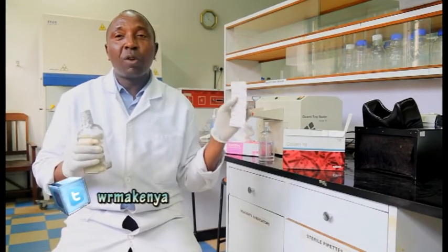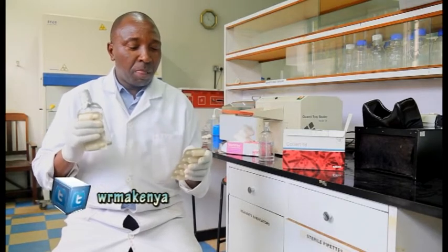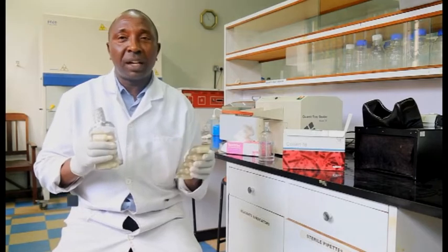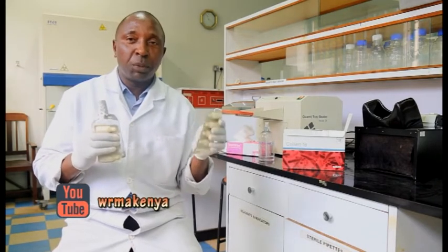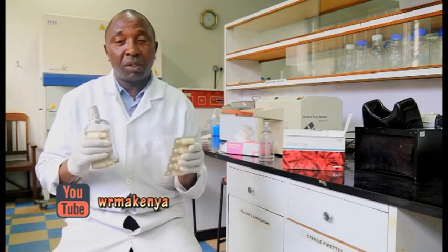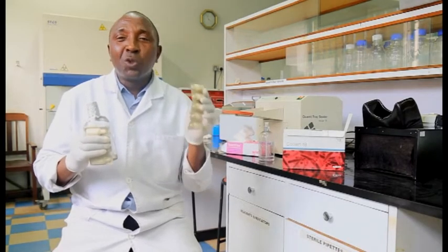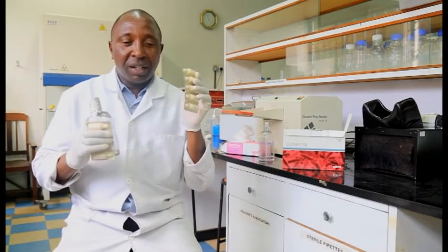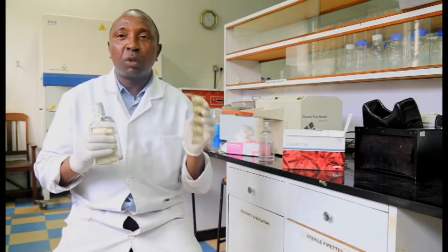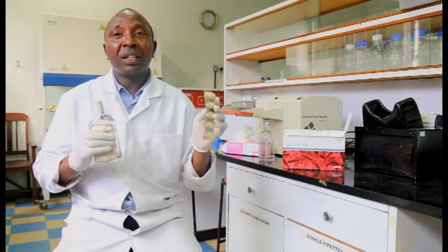It has two nutrients or two substrates. It has a substrate called MUG, which supports the growth of E. coli, and another one called ONPG in short form, the one that supports the growth of coliform organisms. So when you do this test, you are doing two tests at a go. You are identifying, or you are verifying, the amount of general coliforms in water in 100 ml, and also E. coli in 100 ml.